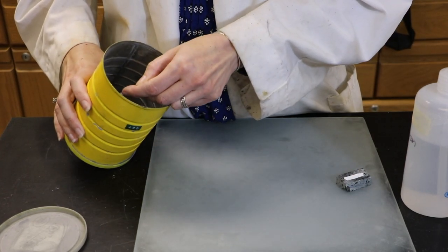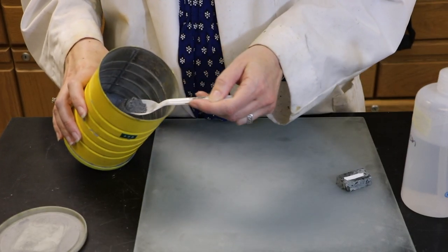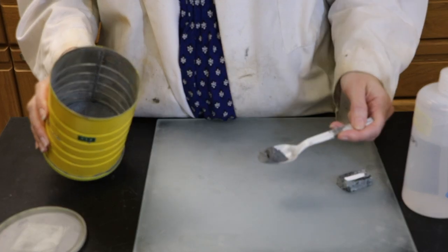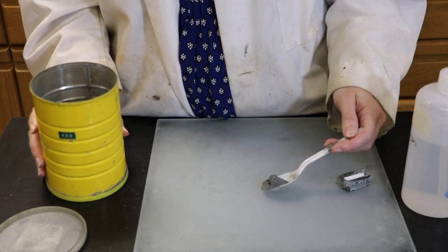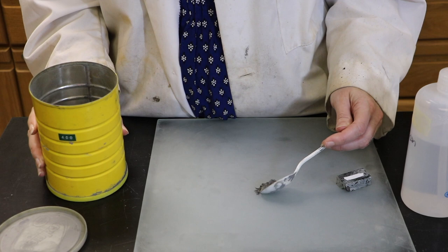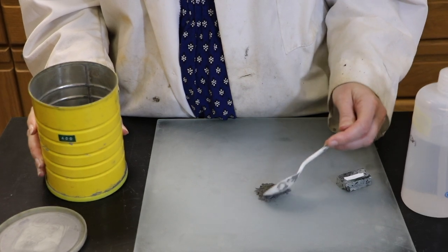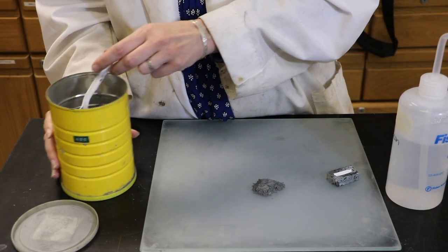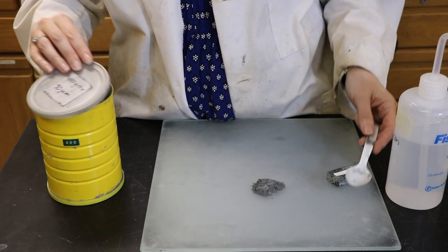You can put some of your polishing powder onto the surface of the plate. If you don't know how much to put, start conservatively, meaning start with not a lot and then work your way up from there if you think you need more later.